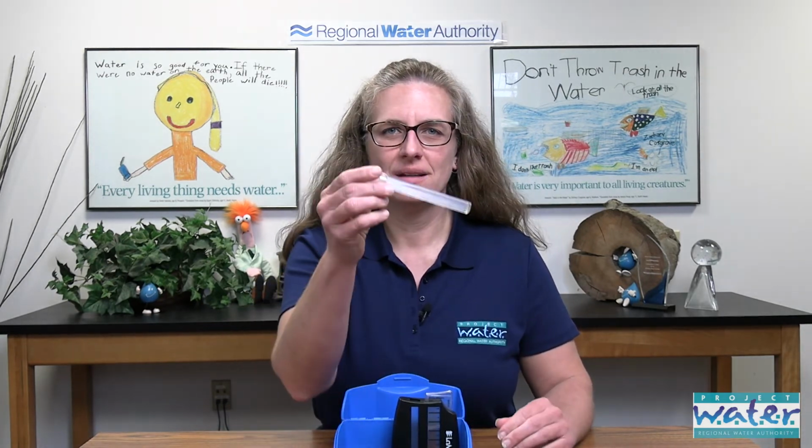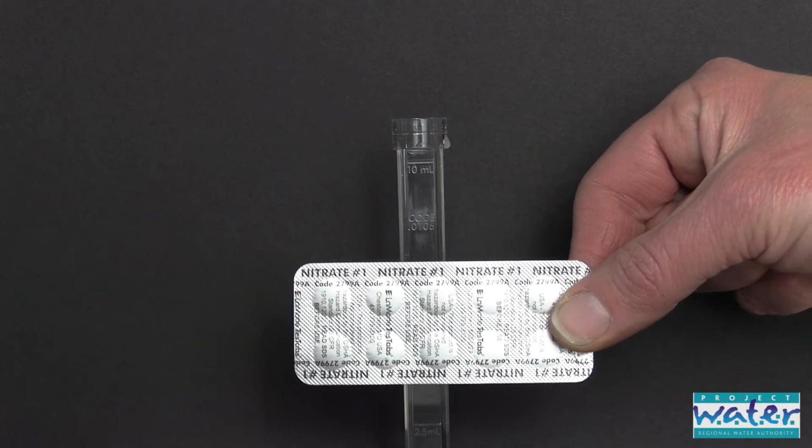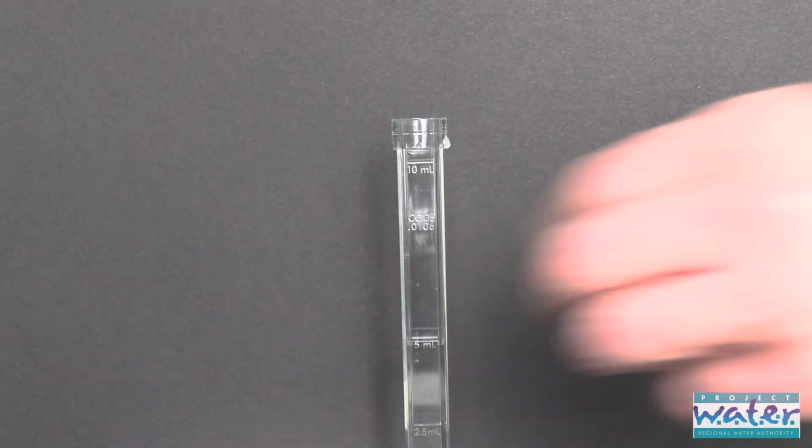Our third test is nitrates. It's in a larger blue box. Inside the nitrate test kit, you have your test tube and the comparator that we're going to use to check our results at the end. Using the pipette, you're going to fill the test tube with water to the 5 milliliter line. Once your test tube is filled, your teacher's going to come around with nitrate number 1.